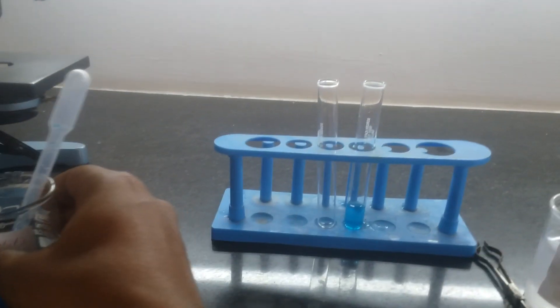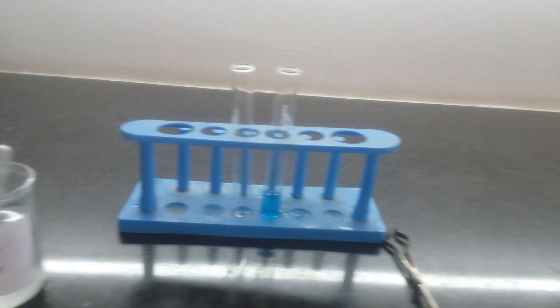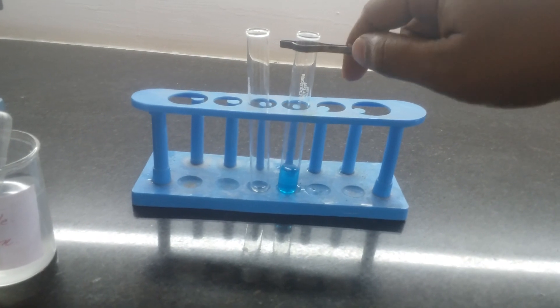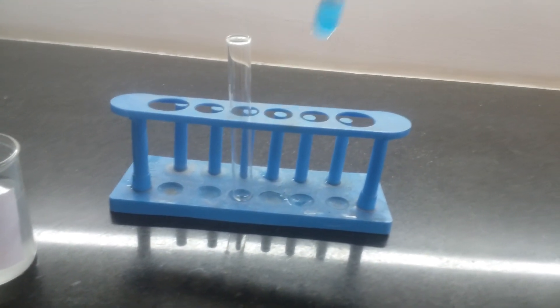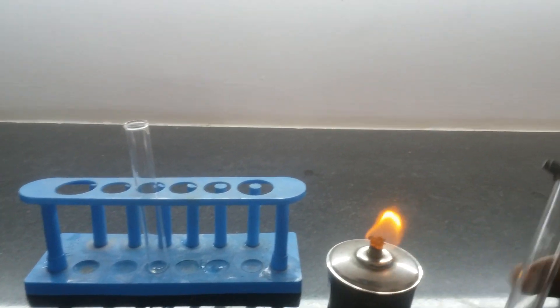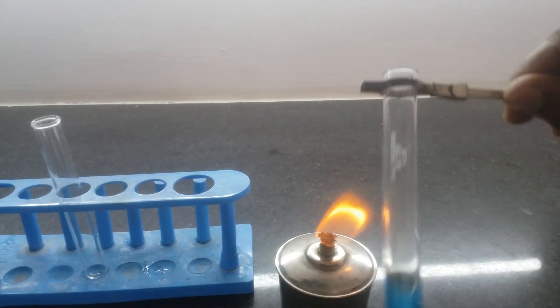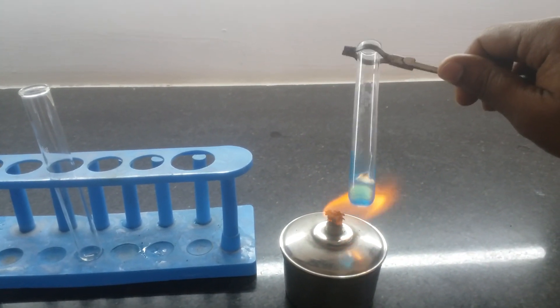The next step is to heat this mixture. Keep aside the sample solution, and for the heating step, hold the test tube with the help of a test tube holder. Heat gently, facing the opening of the test tube towards the wall.